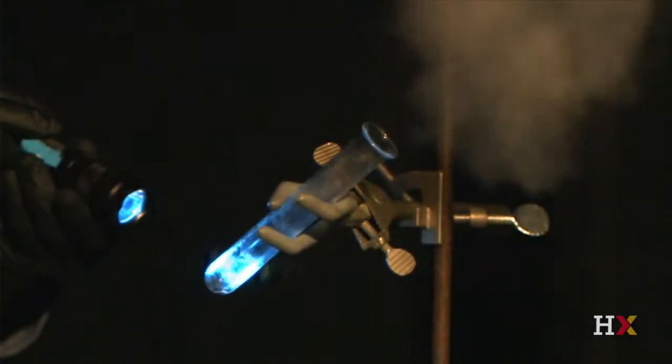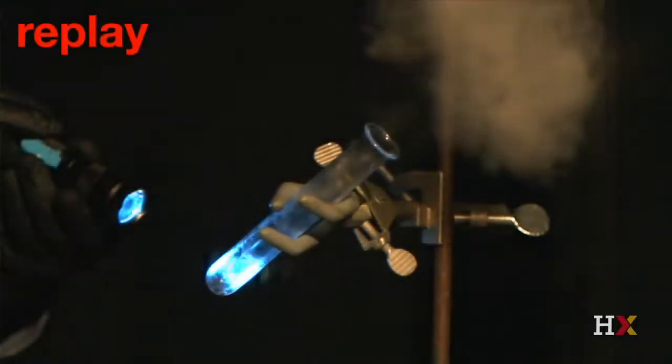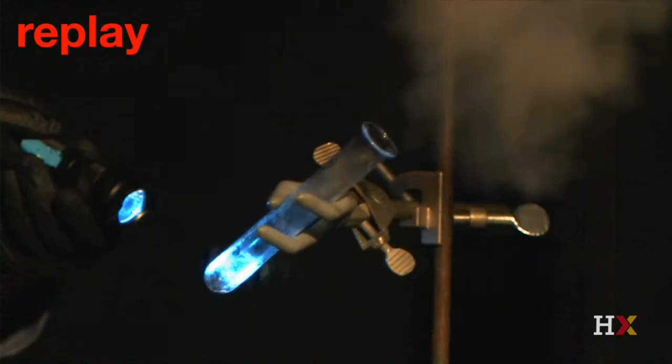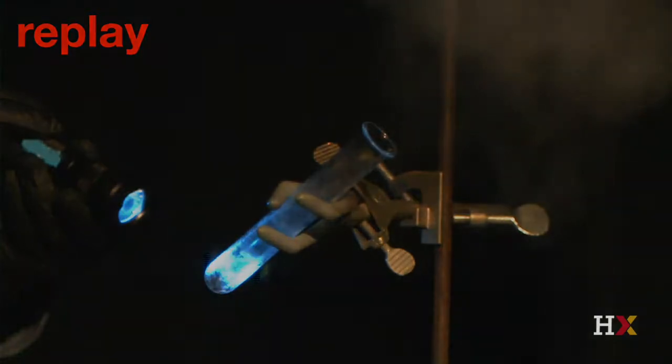The blue photons initiate the reaction by providing enough energy to a chlorine molecule, the Cl2, to split it into 2 chlorine atoms. The chlorine atoms then react with hydrogen molecules, H2, to form hydrochloric acid molecules, HCl, along with more hydrogen atoms. This fast reaction is called a free radical chain reaction.